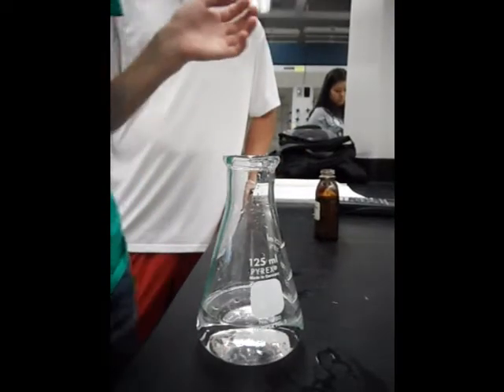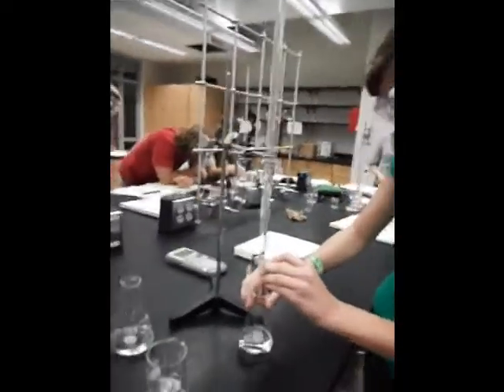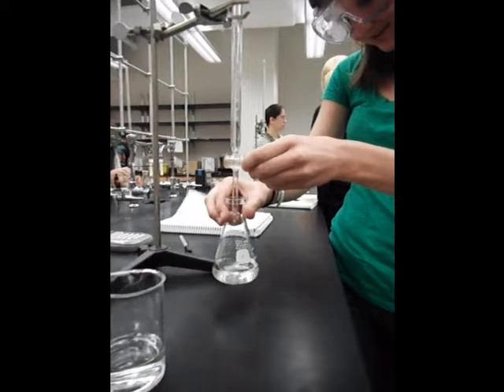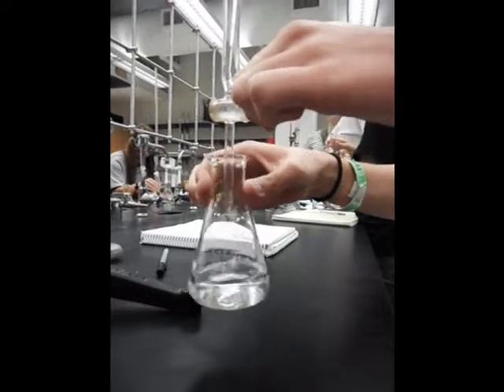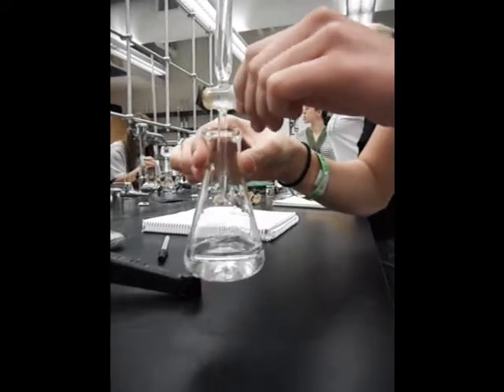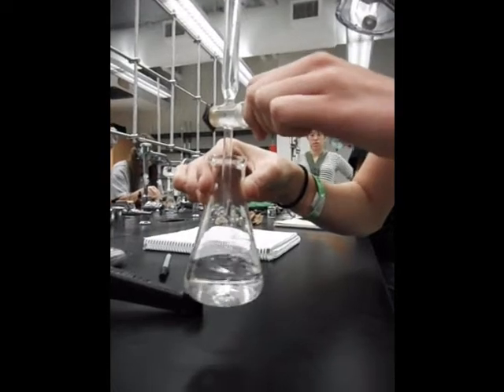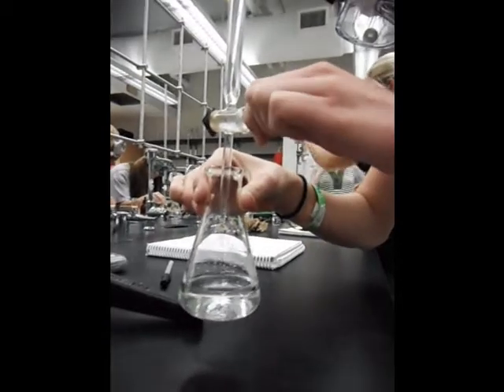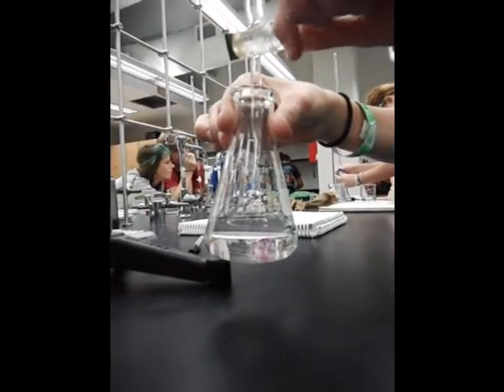KHP. Here we're adding the indicator to the KHP, and that's the initial point of the NaOH. Our indicator is phenolphthalein, and what that does is change color when there is a change in the chemical or physical property of the standard solution. With titration, you're going to slowly add the analyte solution to the standard solution until the endpoint is reached, which is where the change has officially occurred, and the color will change for us to a very pale pink.